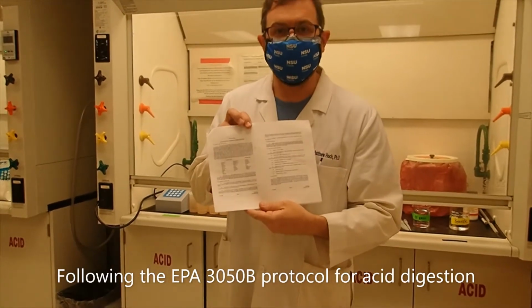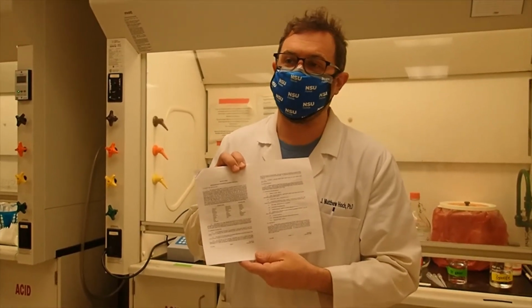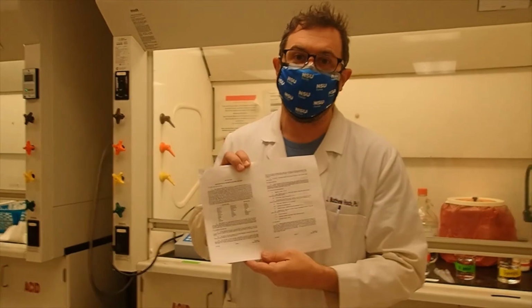We're going to follow the EPA 3050B protocol. This is a protocol for acid digestion for soil, sludges, and sediments. It involves digesting the organic matter and extracting the lead from any undigestible material and suspending it in solution. It's a process that involves us heating it in nitric acid at a nearly boiling temperature and then adding peroxide to fully oxidize the organic matter.